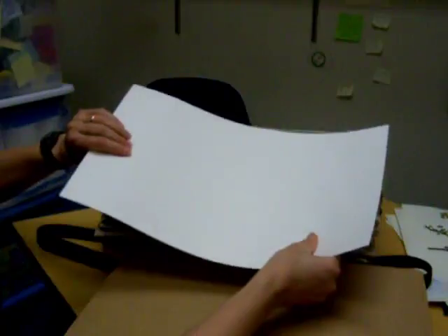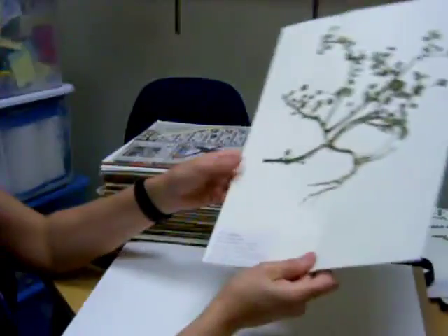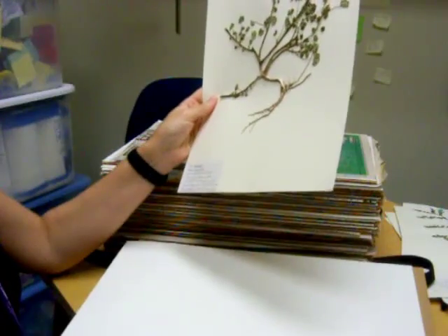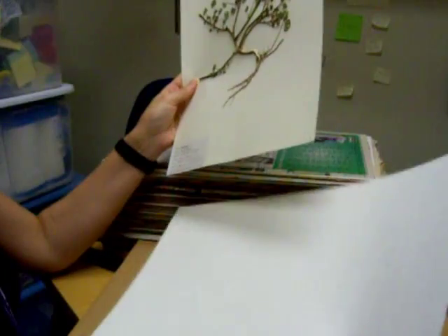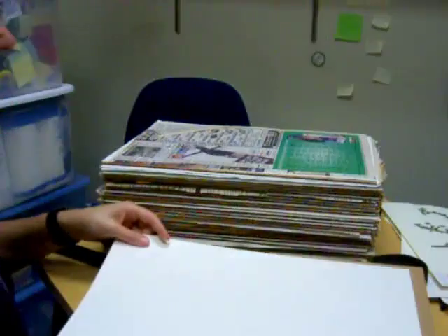Then there's a piece of blotter paper. Note that the blotter paper is different than the paper that you use to mount on — this is much thinner, and mounting paper is much stiffer. Don't use blotter paper to mount your plants; be sure you're using the right thing.